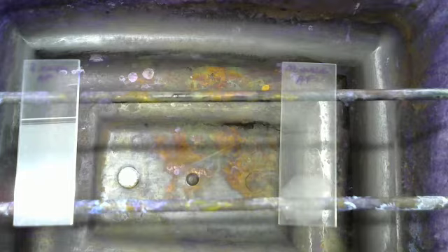And why do we care? Well, let's take a look at some of the bacteria that we have. There's one type of bacteria in our lab that we know for a fact is what's known as gram variable, and that is the members of the genus Mycobacterium. The reason it's gram variable is because the mycolic acid inside the cell wall makes it incredibly difficult for it to stain through normal means. So in some cases, an older Mycobacterium might mix with gram-positives and gram-negatives, and we need to know exactly how to identify that.